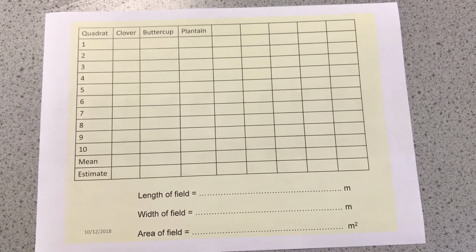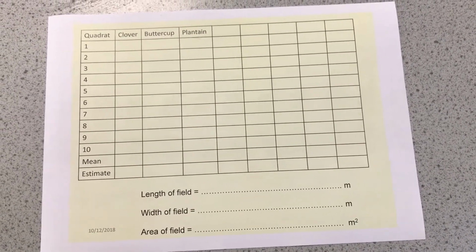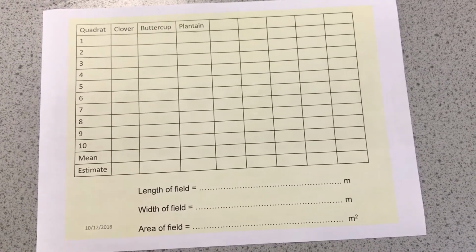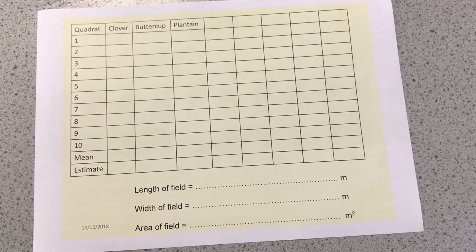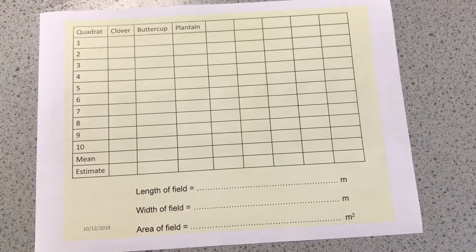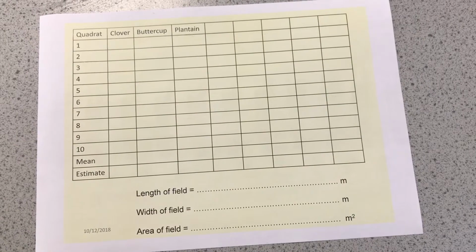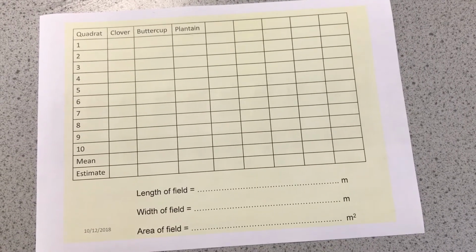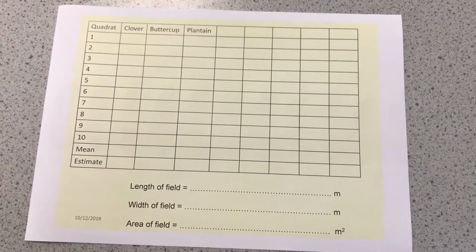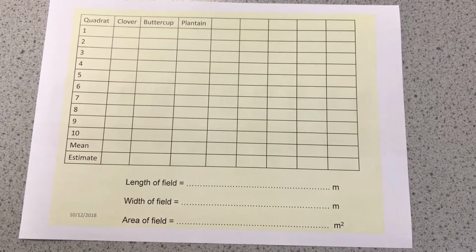And we're looking at doing 10 quadrats, because it's such a vast area. Doing 3 isn't going to give me very reliable results, so I need to repeat the experiment many times. If I repeat it myself, I can call the experiment repeatable. If I collate my information with other people and use their data, I can call my data reproducible, and I have to be able to get the same pattern of results across that data. Repeating it lots of times means that I have reliable data, and that's what I'm looking for, reliable data.